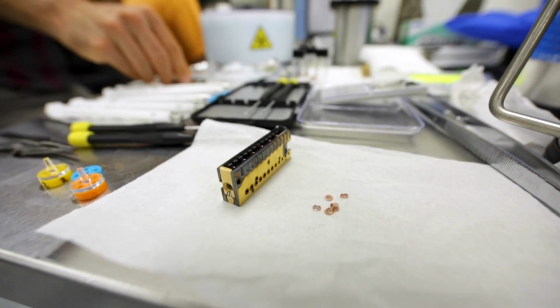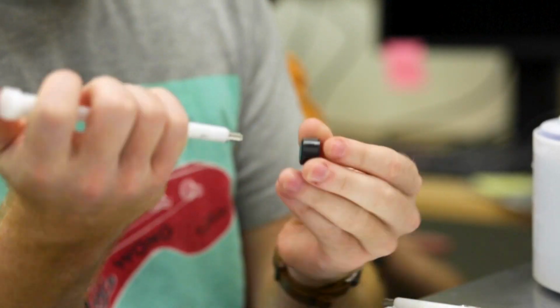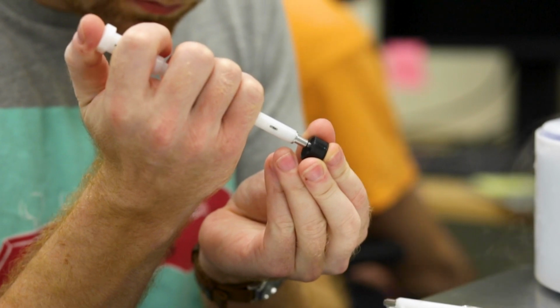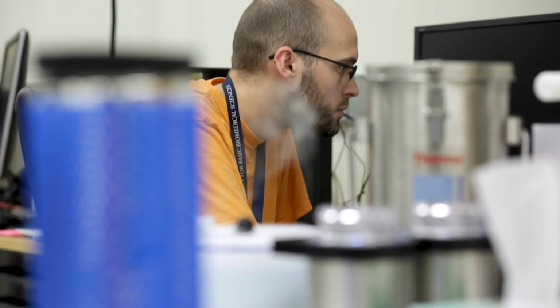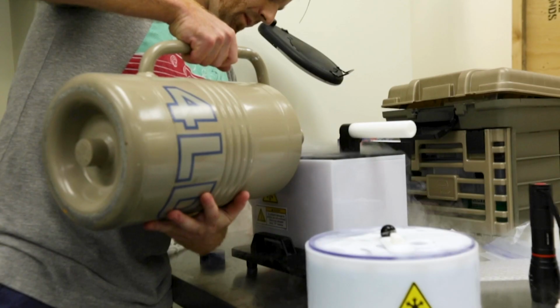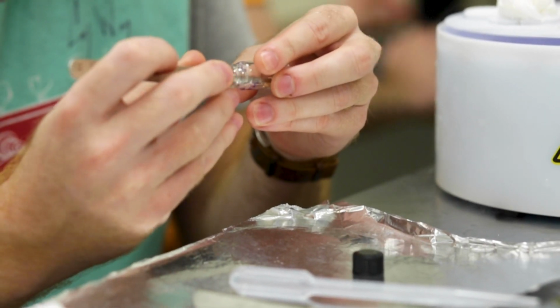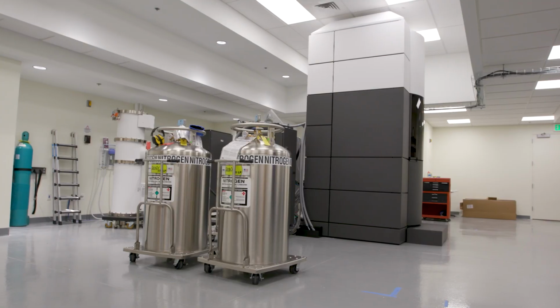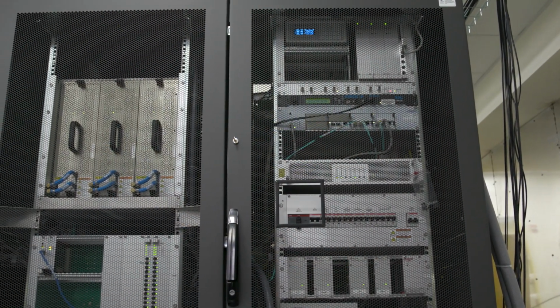A sort of complementary technique to CryoEM would be something called X-ray crystallography. So my lab, when it first started at Hopkins, started by using X-ray crystallography. And the first structure of a CRISPR complex we determined took us 5 years to do, from sort of start to finish. Doing a similar project now, we've completed it in about 6 months. The technology is much easier for these kind of problems.